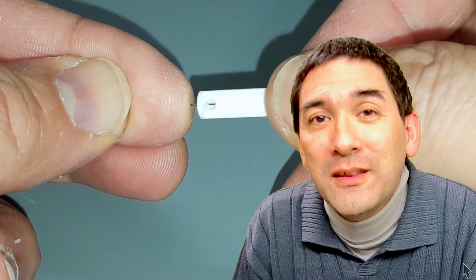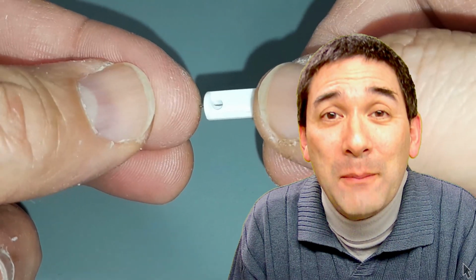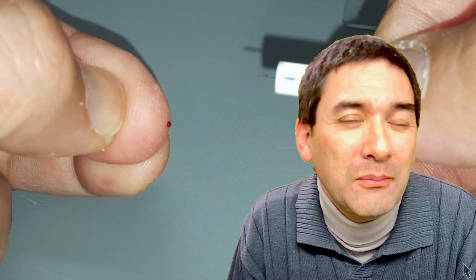Now, what I would like to do now is show you a short clip on how you can observe blood yourself under the microscope. It's fairly easy to do, but you have to make sure that the film of blood is very, very thin. I used a sterile lancet, which I bought recently, and it makes a very small injury, of course, in the skin.